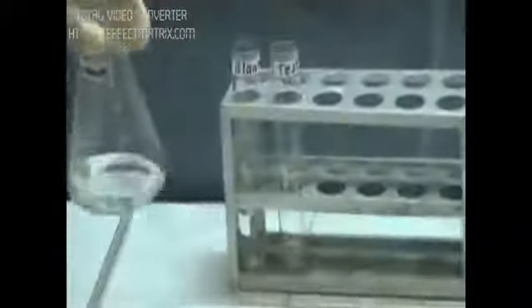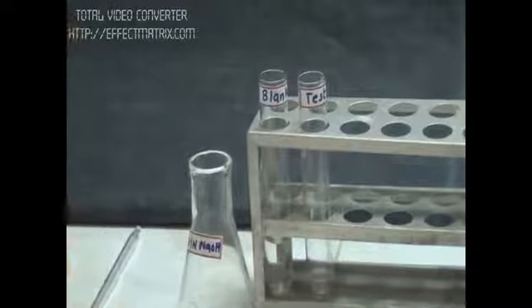10 ml I have taken with the 10 ml pipette. Now I will take 1.4 ml. Now the blank has 11.4 ml of NaOH required. Now in the test, I will add NaOH.